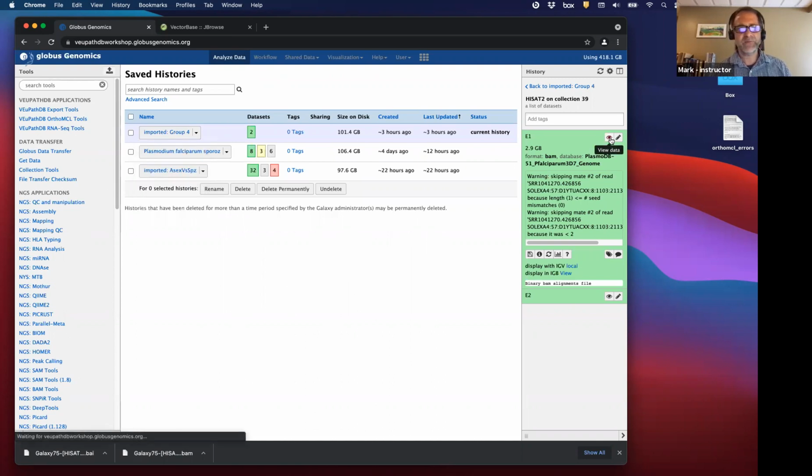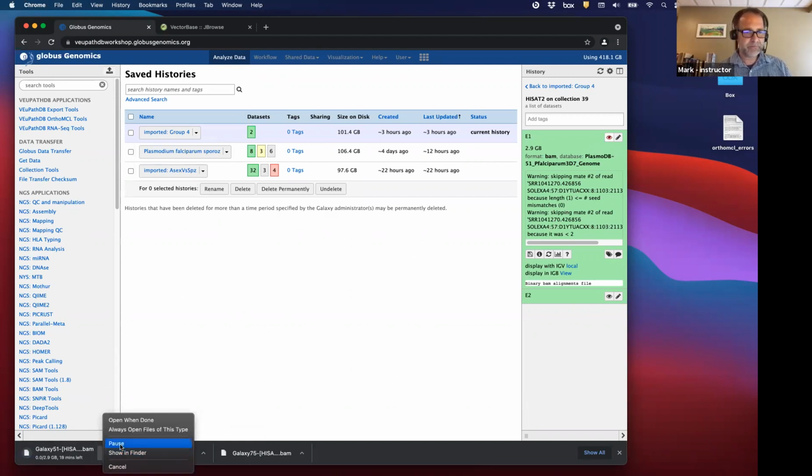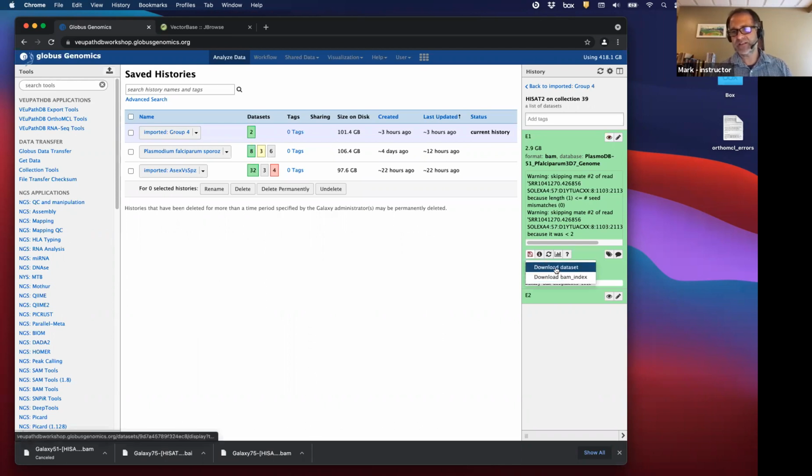And I think we can look at the BAM file. No, it downloads it. I'm going to cancel that one. So just to let you know, here's the BAM file. That is an alignment file. It's a binary alignment file, and it is highly compressed, and it's ordered by sequence. And you actually can look at those files. We're not doing that today, but I just want to let you know that you have access to this file as well, and you can look at it. You can download it here. This downloads the actual BAM file. You also need the index. And I did that with Gloria, another instructor, today.